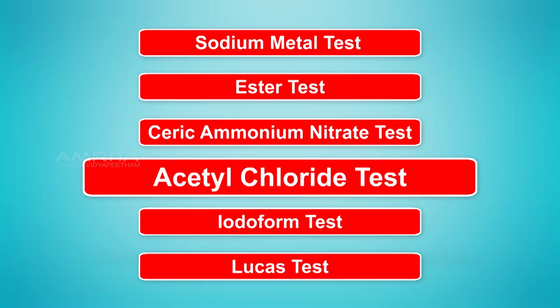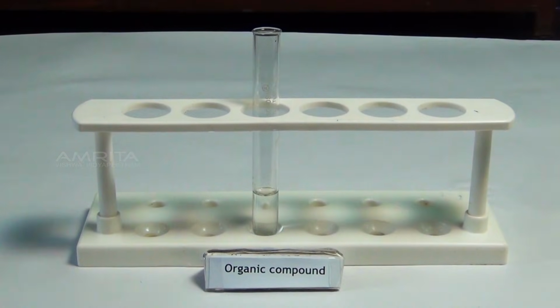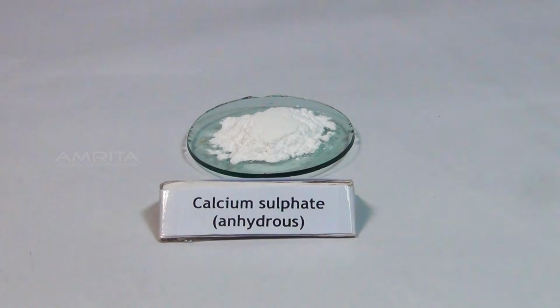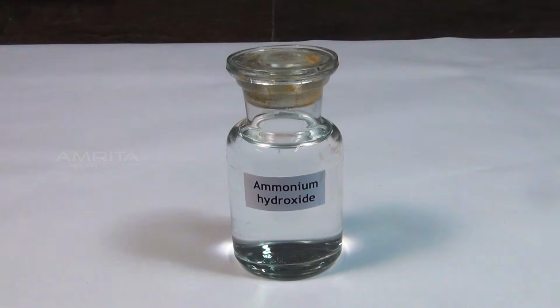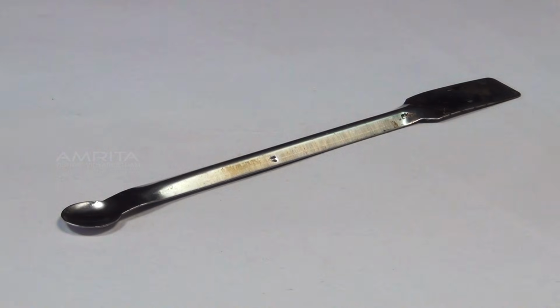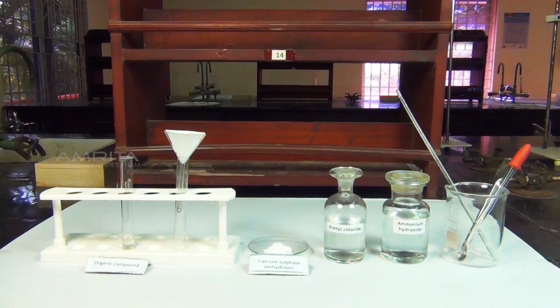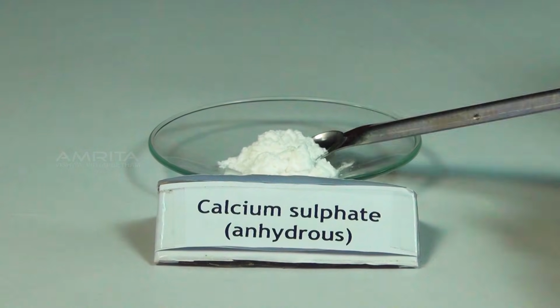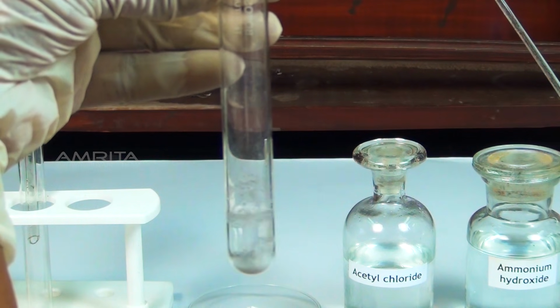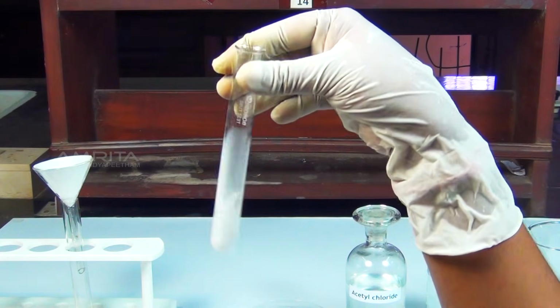Acetyl chloride test. Materials required: organic compound, anhydrous calcium sulfate, acetyl chloride, ammonium hydroxide, test tubes, dropper, spatula, funnel, filter paper and glass rod. Procedure: take a small quantity of organic compound in a test tube. To this, add a small quantity of anhydrous calcium sulfate using the spatula.